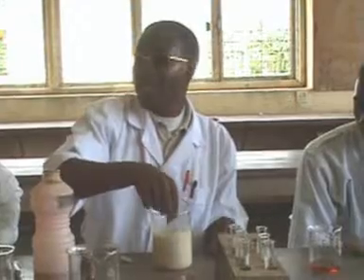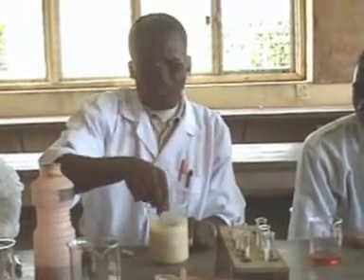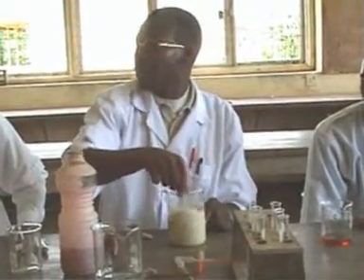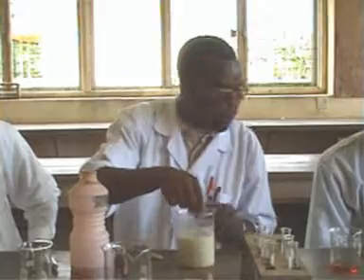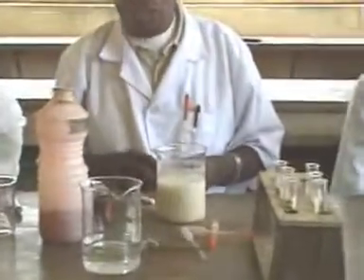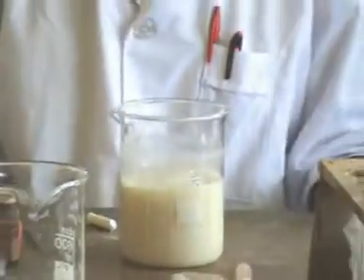But candidates will know that in an exam, the solutions are not named. They just have solution A. So this is to tell them that these solutions that they see are very common things that are with them. They can be something strange, but we are the ones who prepare the solution, and they are not different from this one that I'm preparing. So if I prepare this one now and put it and write solution A, and then ask you to test for the contents of solution A, you will not know what is there. You cannot know whether it is whatever. There are many things that can be white. You will not know what is there. But I, the examiner, I know that it is corn flour.